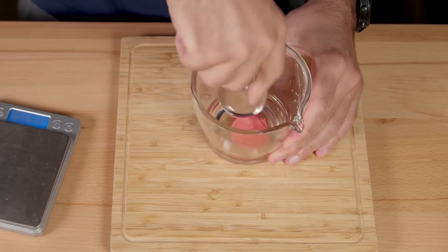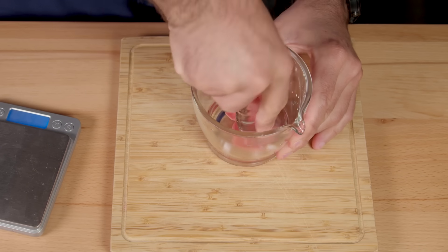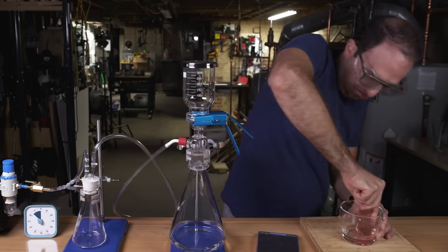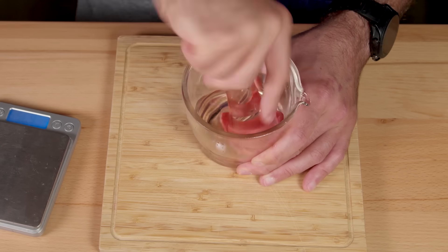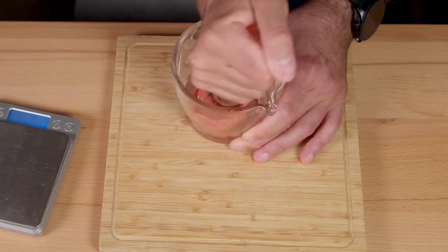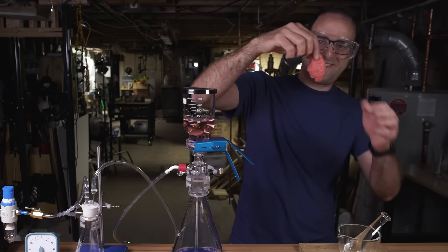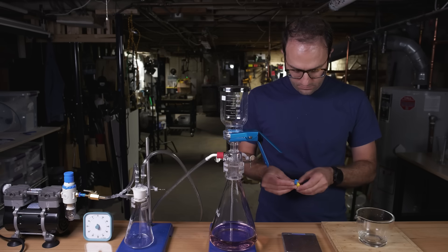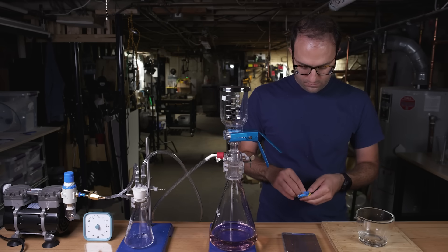At least I thought it was simple before I actually did it. Mashing the gum up in a mortar and pestle was really hard. It took a long time and didn't come close to achieving the same gum-like texture that you get when you chew it in your mouth. So I made the crucial decision to chew the gum instead.